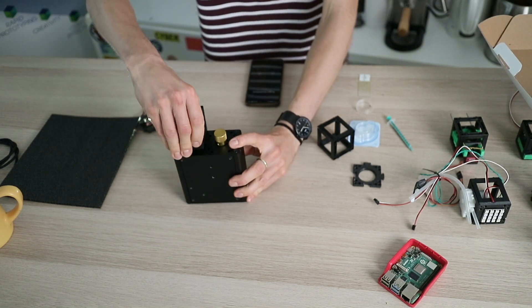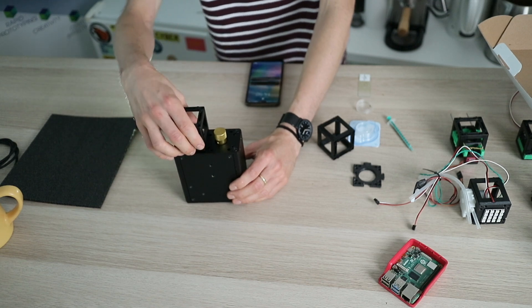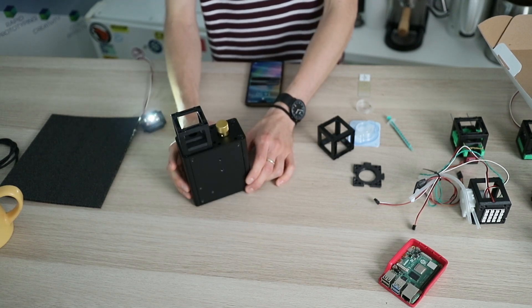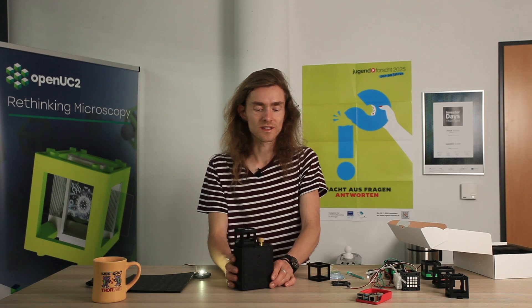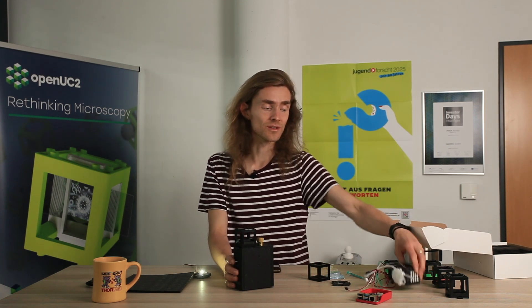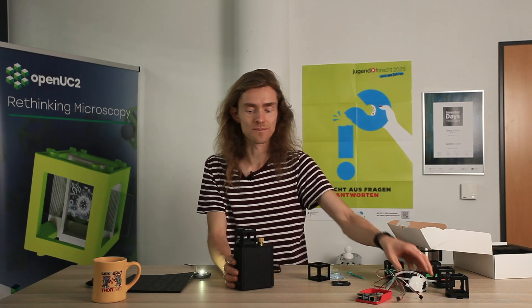On top here you have the degree of freedom to put any cube you have to maximize your functionality. Today we wanted to give you a little tour of what's possible with this at first glance, and then later on we want to show you how you can add different pumps and LED arrays to maximize the functionality.